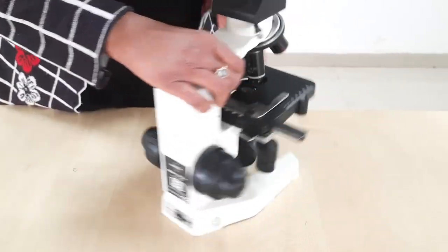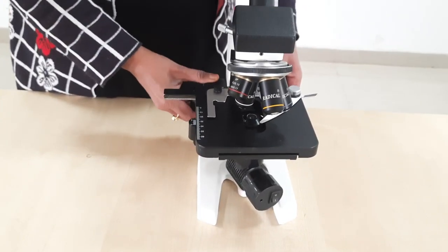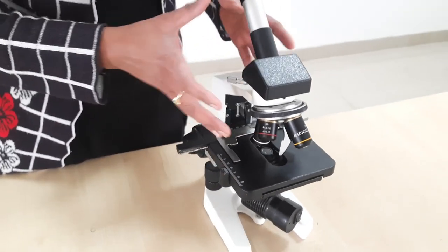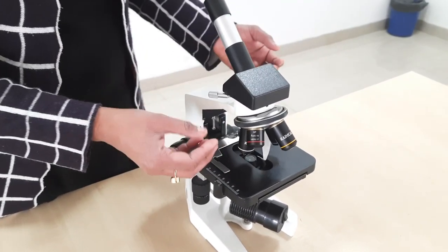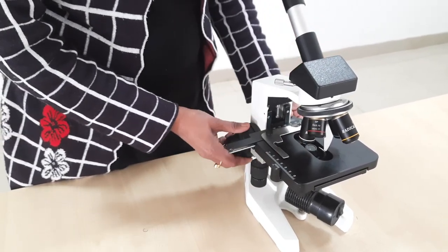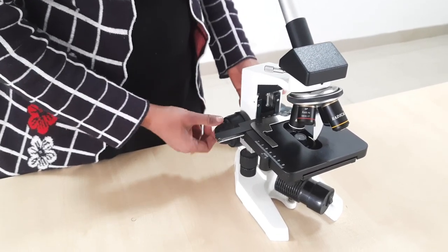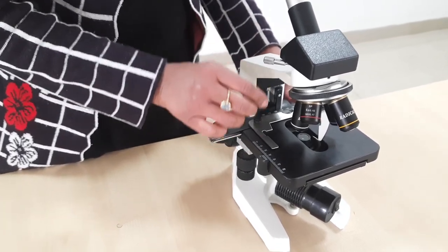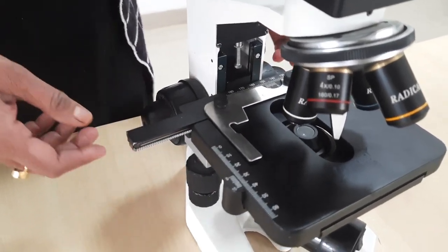These screw heads move the stage — in earlier microscopes they used to move the optical tube instead, but the function is the same: to increase or decrease the distance between the specimen and the objective lenses. One rotation of the fine screw moves the stage about 0.1 millimeters.